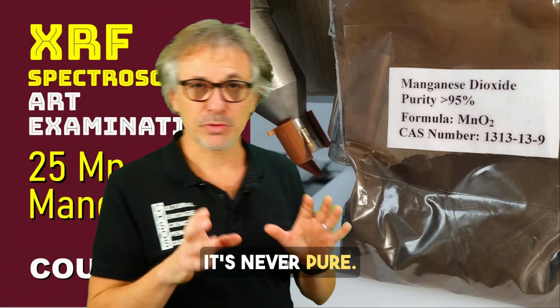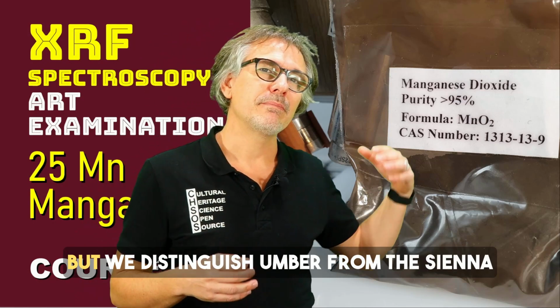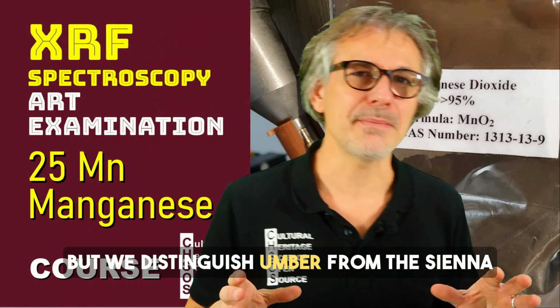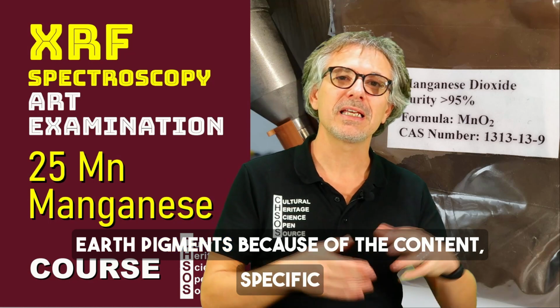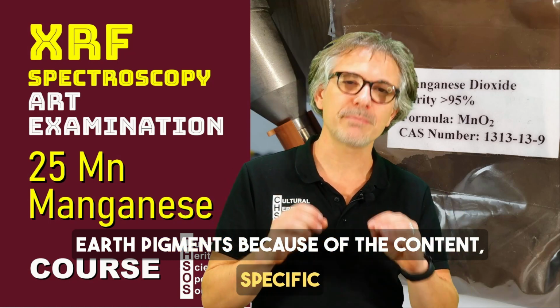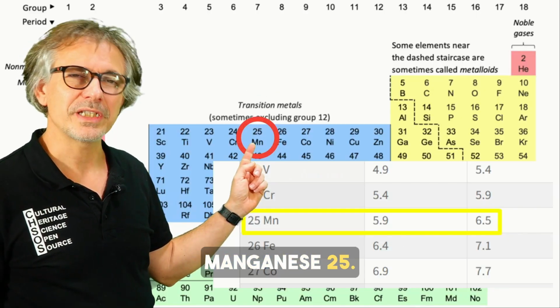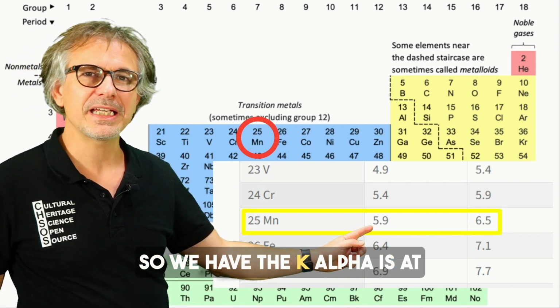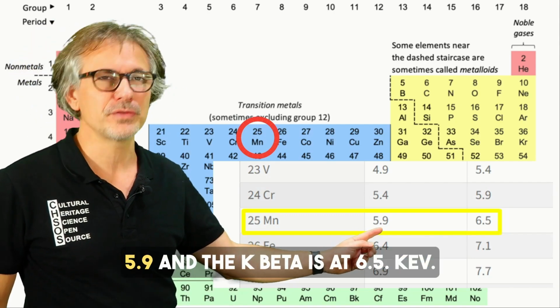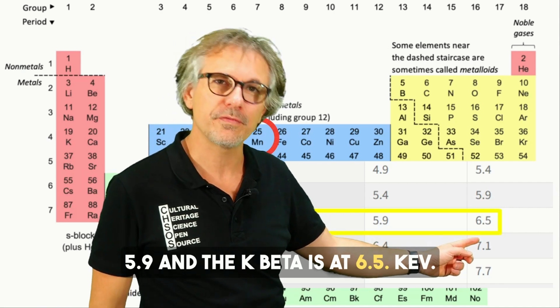It's never pure, it's always mixed with iron oxides, but we distinguish umber from the sienna earth pigments because of the specific content of manganese. Manganese 25, and these are the X-ray lines. The K alpha is at 5.9 and the K beta is at 6.5 keV.